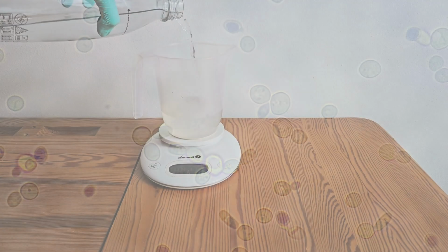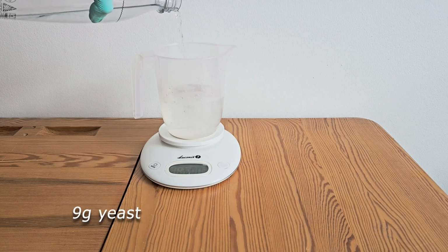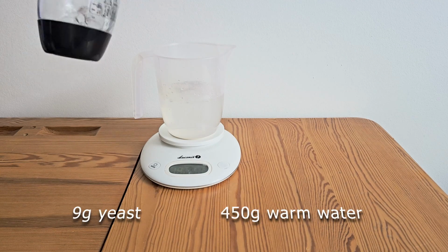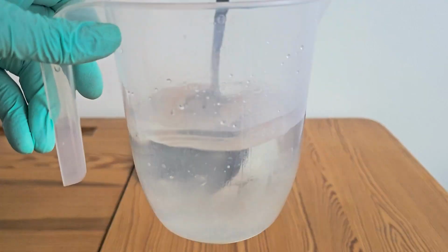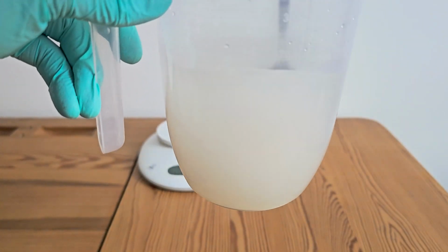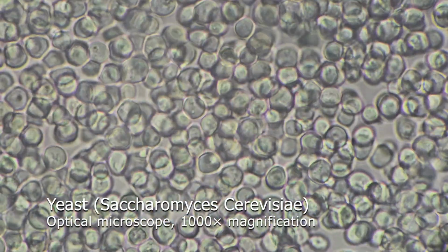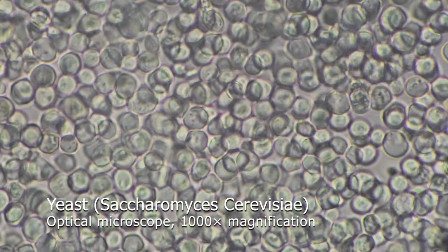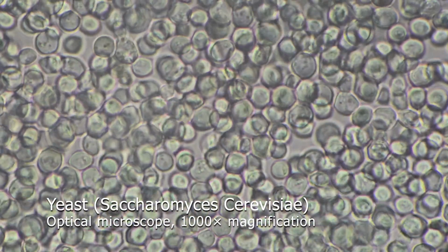The first step in making bread is dissolving the yeast. I add 9 grams of yeast to about 450 milliliters of warm water and stir until it is completely dissolved. If we look at a sample like this under the microscope, we can see individual cells of baker's yeast, Saccharomyces cerevisiae. In just 1 gram of yeast, there can be as many as 25 billion cells.